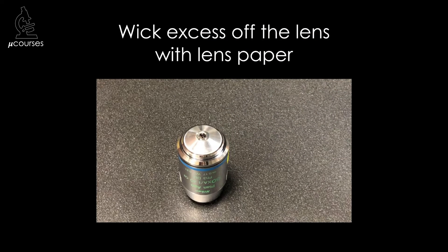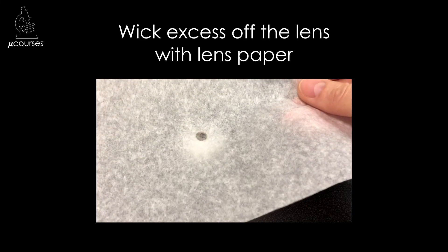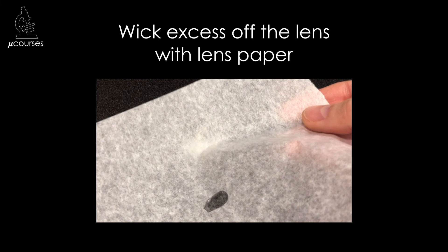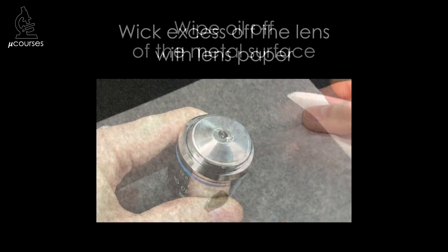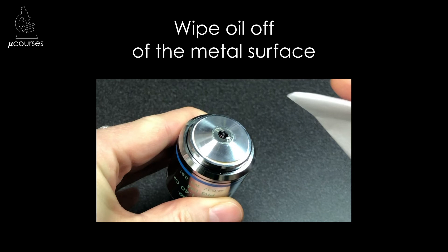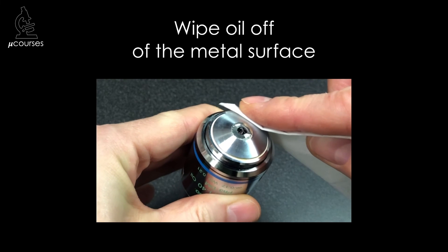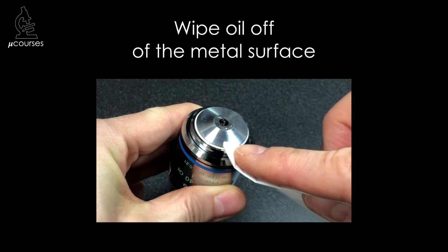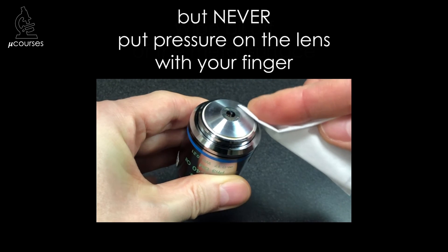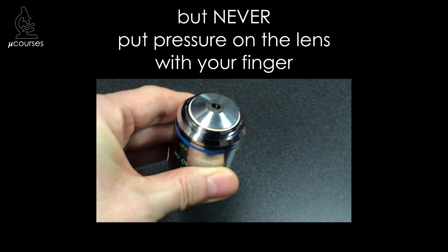At the end of your imaging session, you should use a piece of lens paper to wick the oil off the lens. There's no need to put any pressure on the lens — just wick the oil off. If you find that there is oil on the metal surface that has dripped down, you can use lens paper and your finger to carefully wipe that oil away. You don't want to ever put any pressure on the lens with your finger, so only do this on the metal surface.